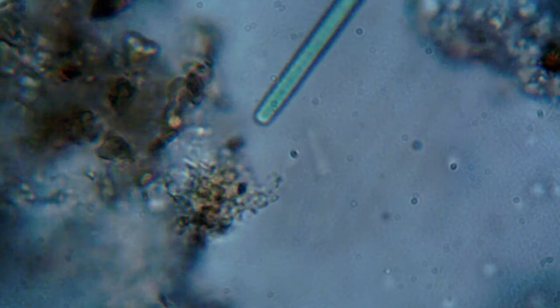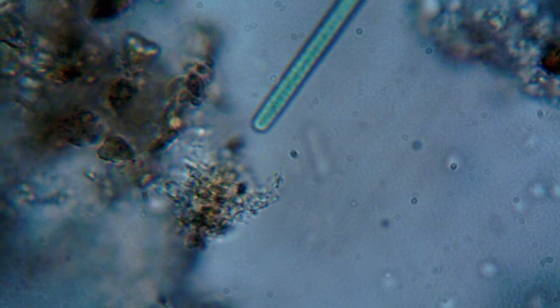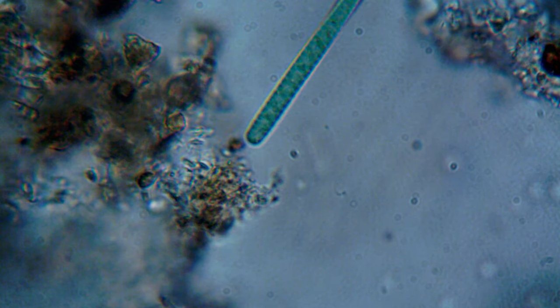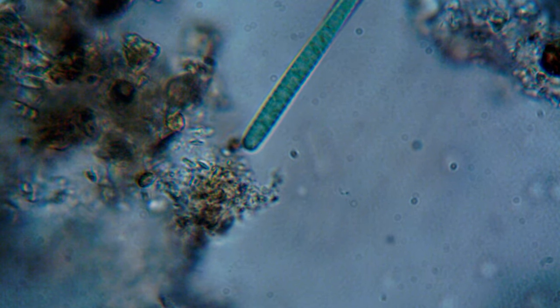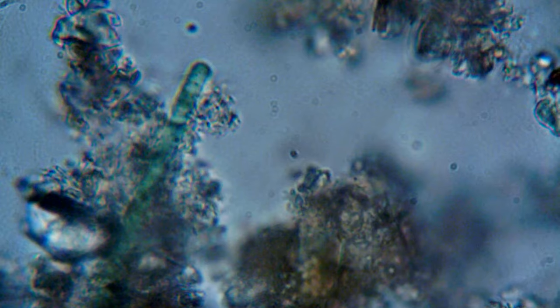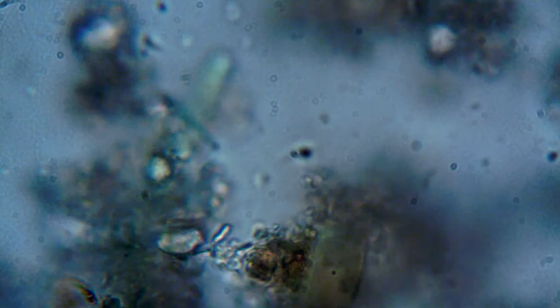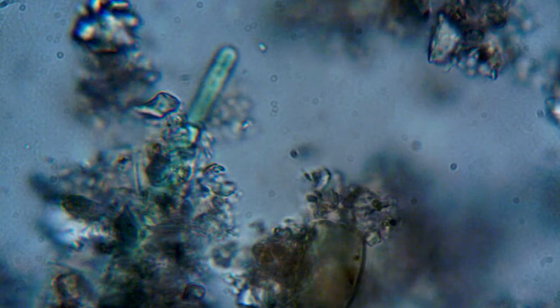Imagine that you want to see something very small, which would be impossible to see even if you look closely. Or maybe you just want to see the smallest details of something. In that case, this is what you'll do.